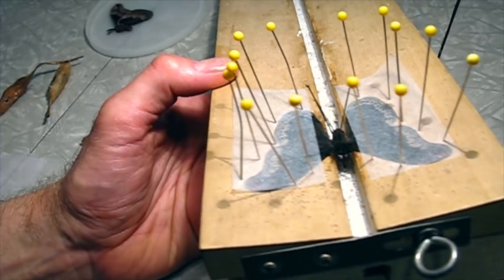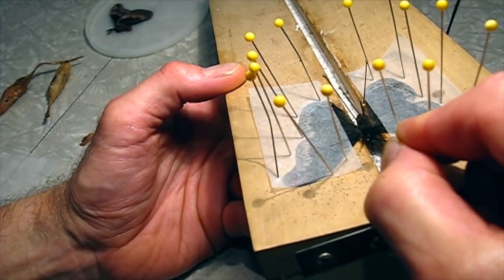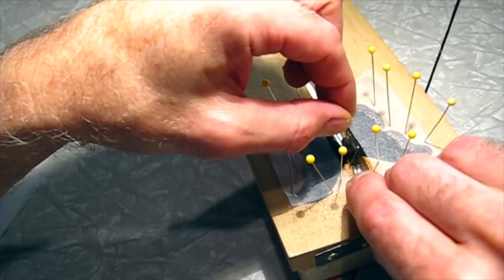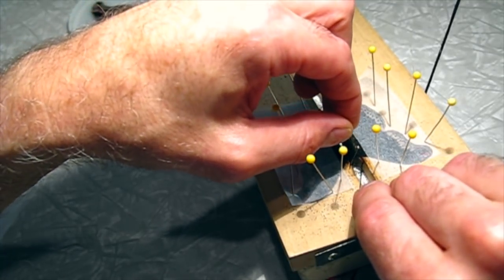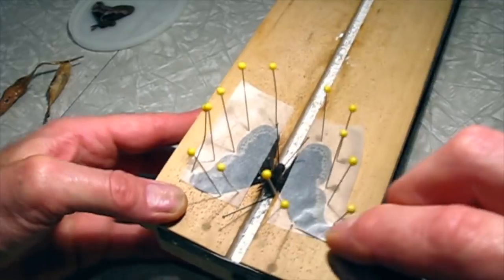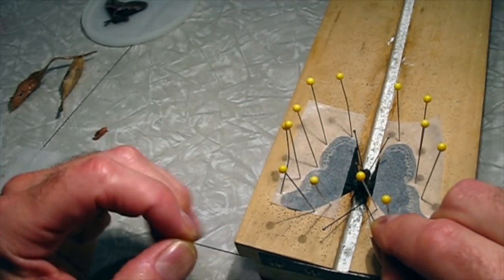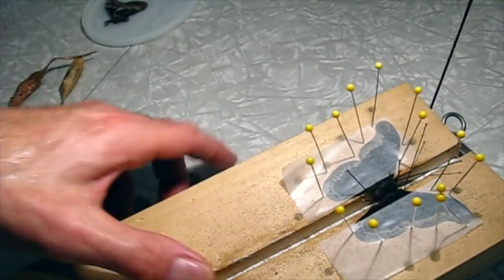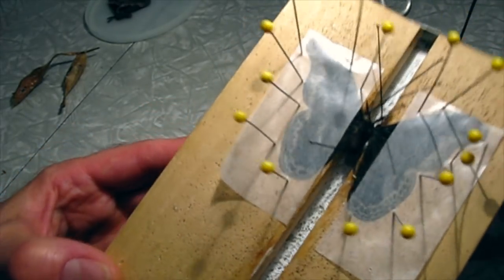Finally, I'm going to try and grab the front legs and lift them up a little bit. I like to have the front legs up where we can see them. Some of the Saturnian moths have nice patterns on their legs, so it's kind of nice to see them with the legs out. This one's not particularly interesting, but still. I'll check the antennae again and get them looking symmetrical. That looks pretty good. And this is the other male — it's a little bit larger.